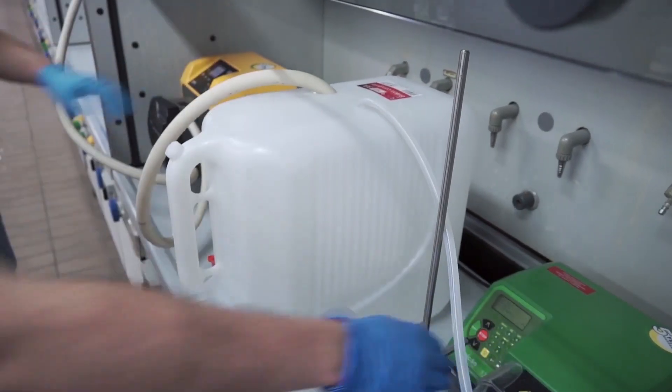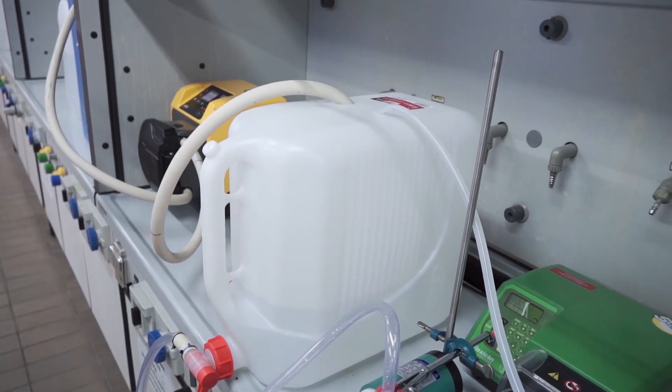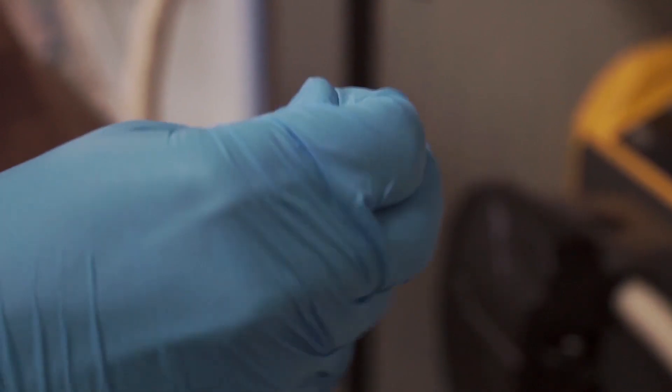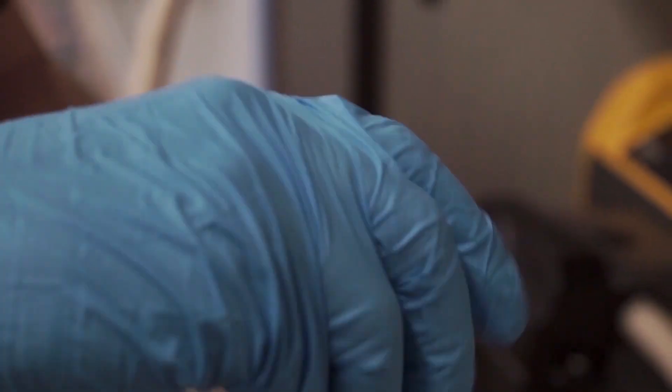Once the desired production is finished, it is necessary to stop the plant by switching off the pumps at the same time and ensuring the cleanliness and maintenance of the system, with a particular focus on the state of wear of the tubes.